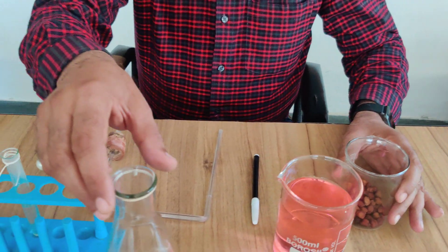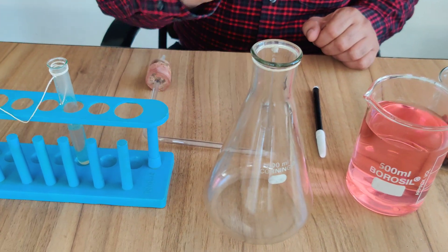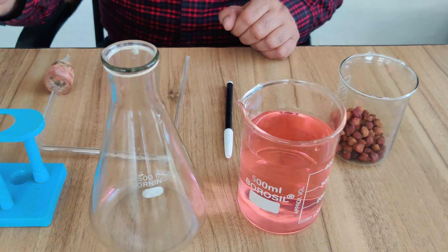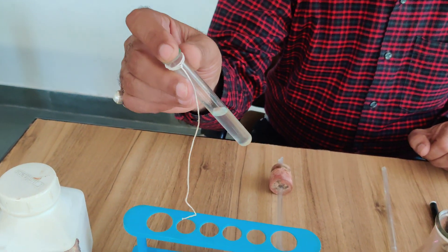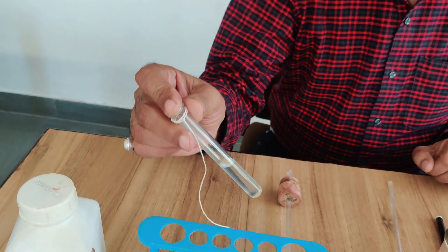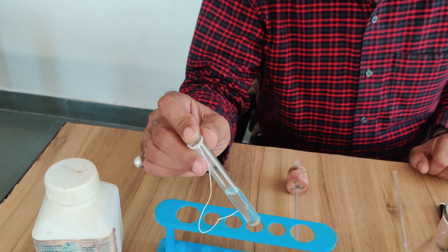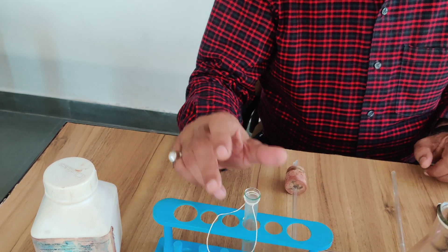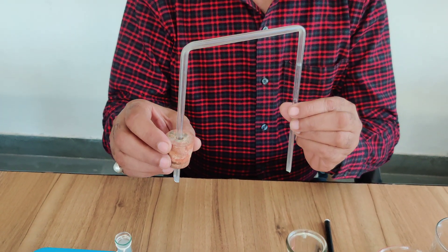Beside that, we need a conical flask. This is simply colored water. In this test tube, I have taken KOH solution. You know the property of KOH solution — it absorbs carbon dioxide. This is a delivery tube fitted with a cork.